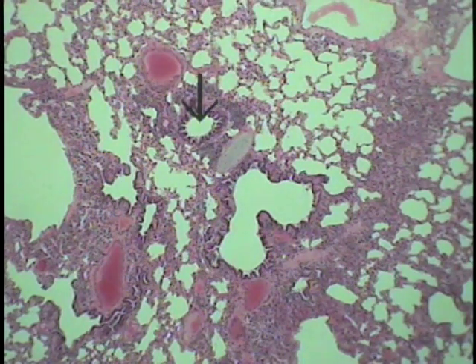Then I think this particular terminal bronchus went in the direction of the arrow and then split into two regions. So we're getting a pretty good portion of the hyaline cartilage as we cut it tangentially, and one can obviously see the glands associated with this particular airway passage. Lymphoid tissue can also go down to about this level.